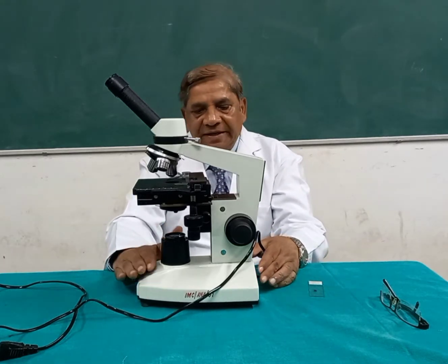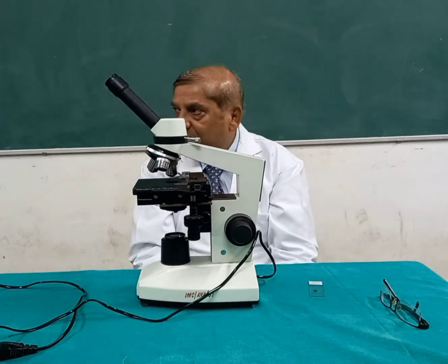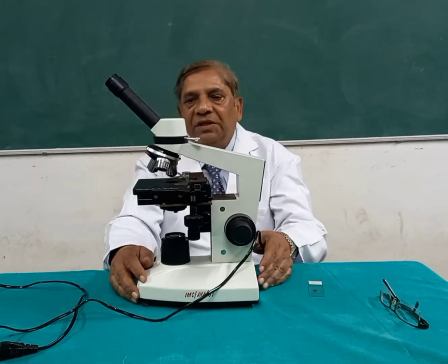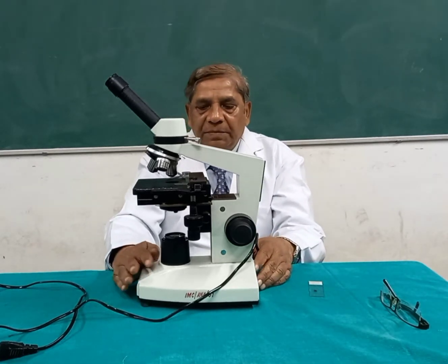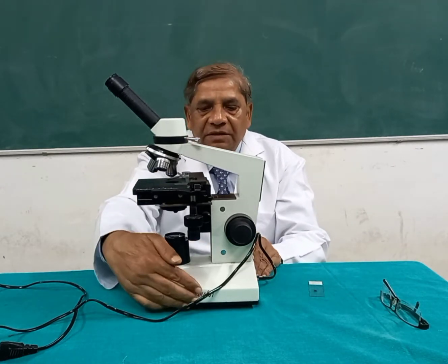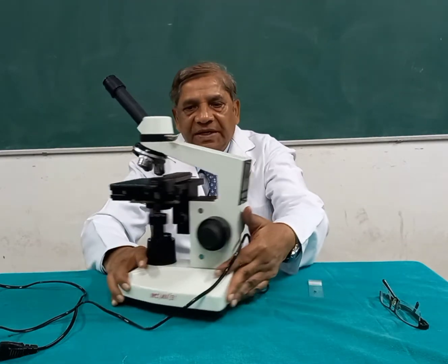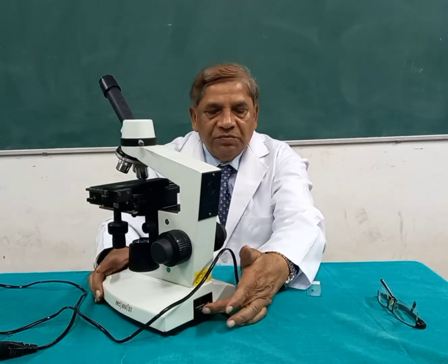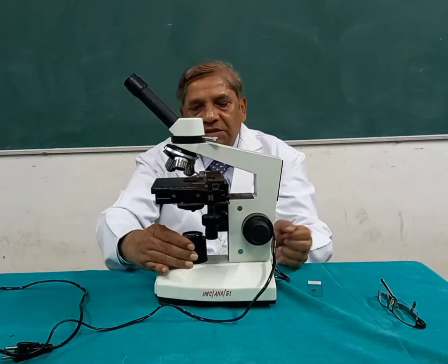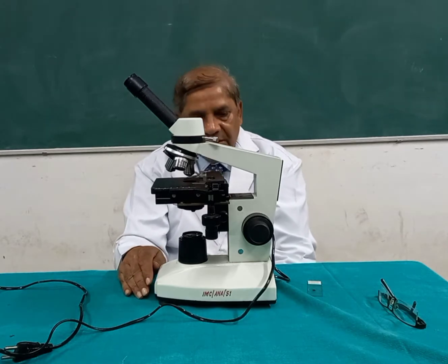Now, this is the light microscope because it uses light as a source for the enlargement of the image. Light may be either artificial or natural light. Now, the part of the microscope where it is resting is known as the base. On the back side of this base, there is a switch for off and on of the light source. On the base is the source of the light, where an electric bulb is fitted.